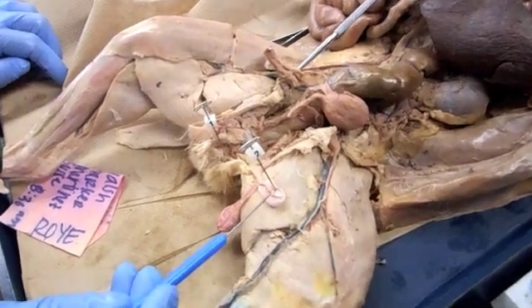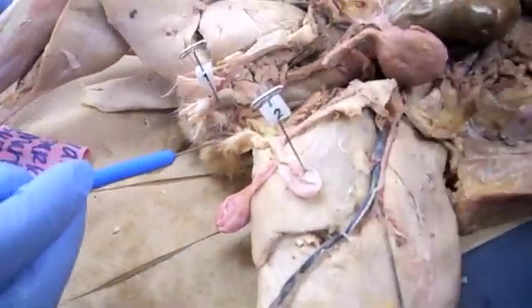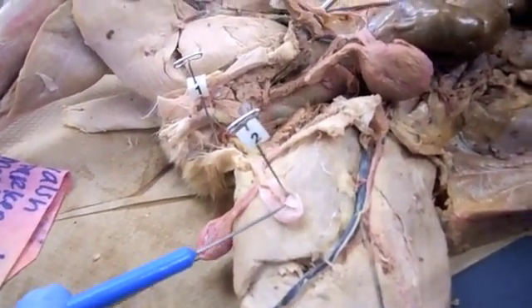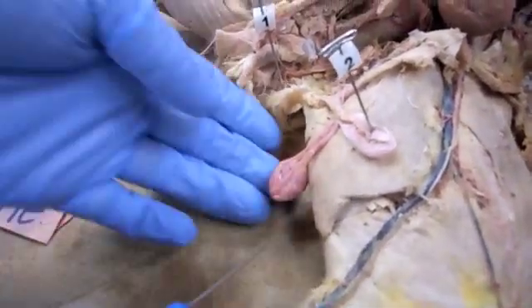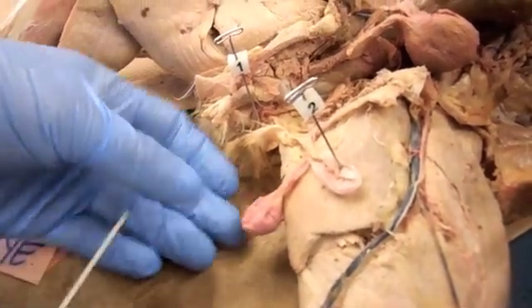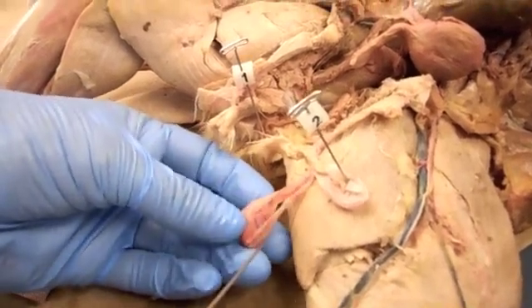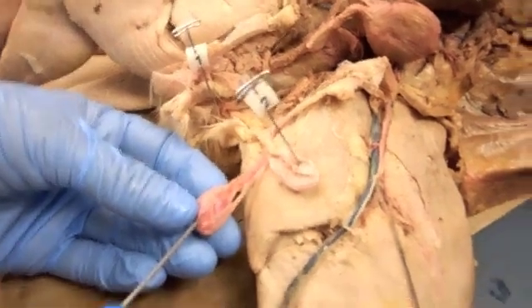We have the scrotum, the tunica albuginea, the testes, the epididymis on the top, and the spermatic cord.